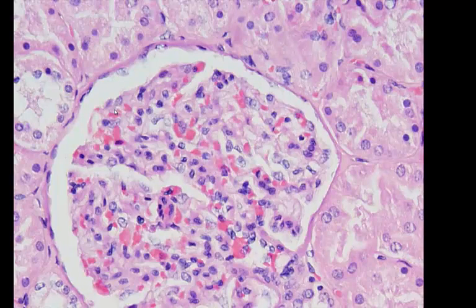Now see if you can find the simple squamous cells on this slide. They're lining Bowman's capsule again, right here. Here's a big nucleus to one. Here's another nucleus. Here's another one. Here's another one. These are the simple squamous cells here, lining the inside of Bowman's capsule. And here's our big glomerulus, where urine would be formed inside of our kidney. So this is what the inside of a kidney looks like.